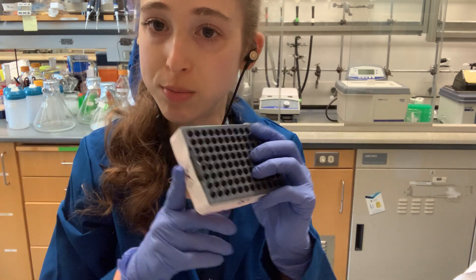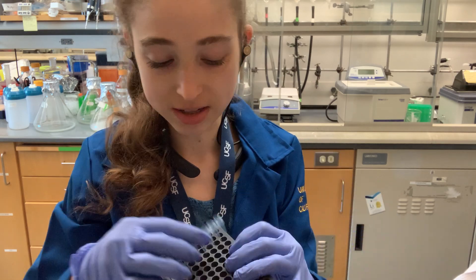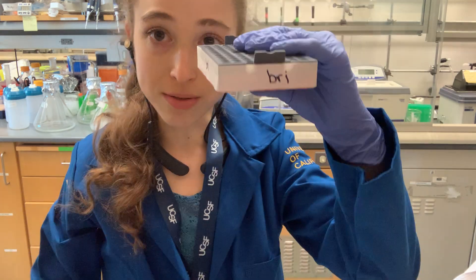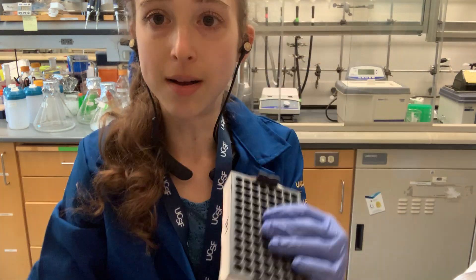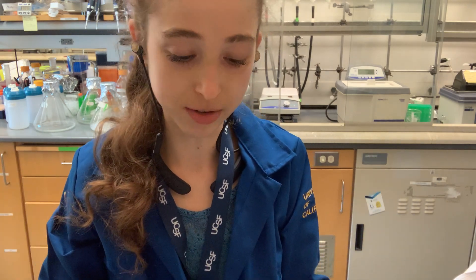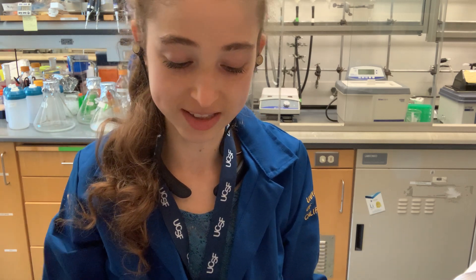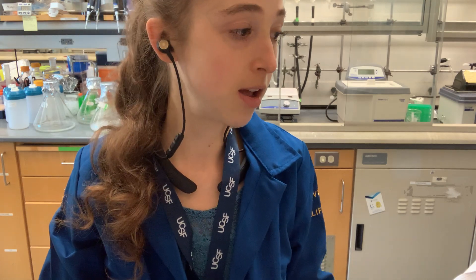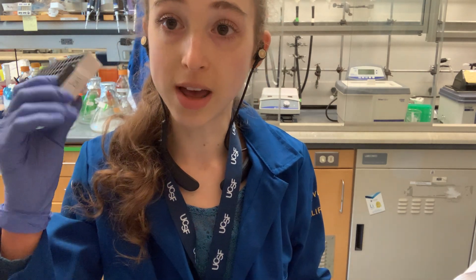It's really helpful when you take your PCR strip over to the PCR machine — you can stick your rack on top of the block. That way people know you are using that PCR block, and when the run is done, if you haven't taken your stuff out, they can come get you or stick your tubes in the fridge if they need to use the block.